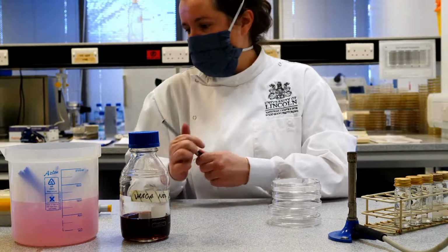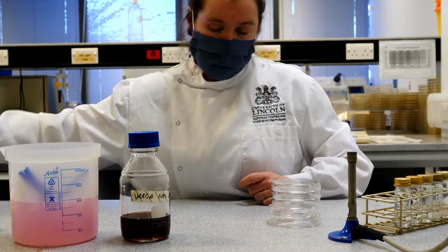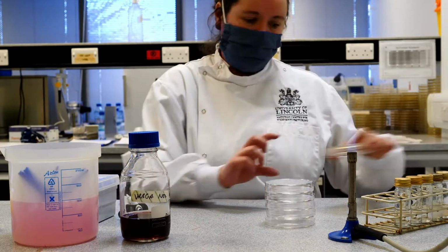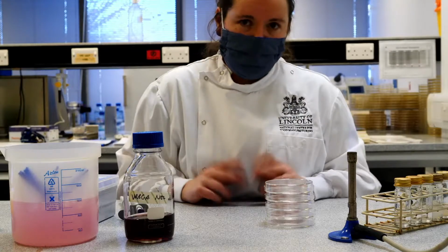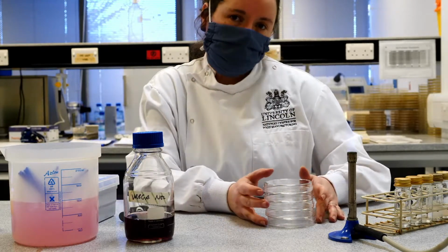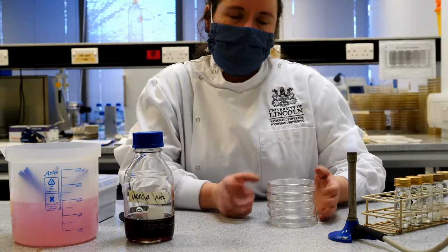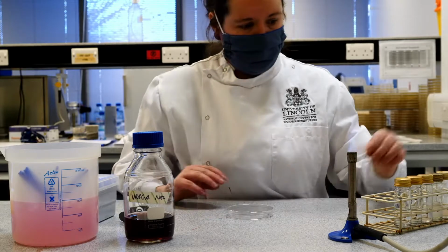The other thing sometimes you might need to consider is labelling up your plates, if they haven't already been done for you, with the type of agar that they contain. Now, it's very easy for us today. Our nutrient agar is beige colour and our VRBGA is purple, so we're not going to get those mixed up. But actually a lot of microbiological growth media are very similar beige colours, so it's important that we know which is which so that we can identify them. So sometimes we do need to label our plates with the different colours as well.